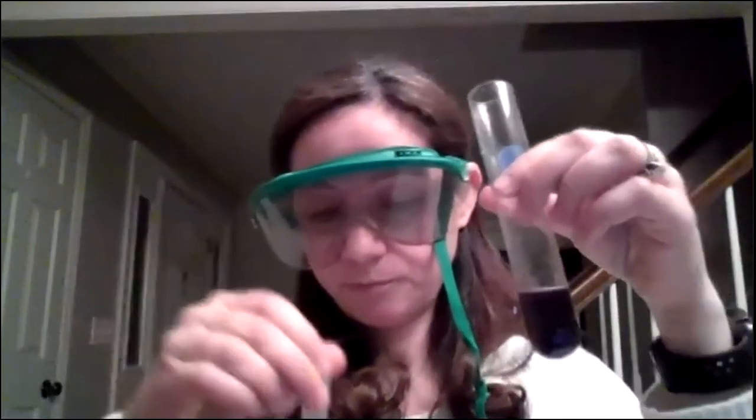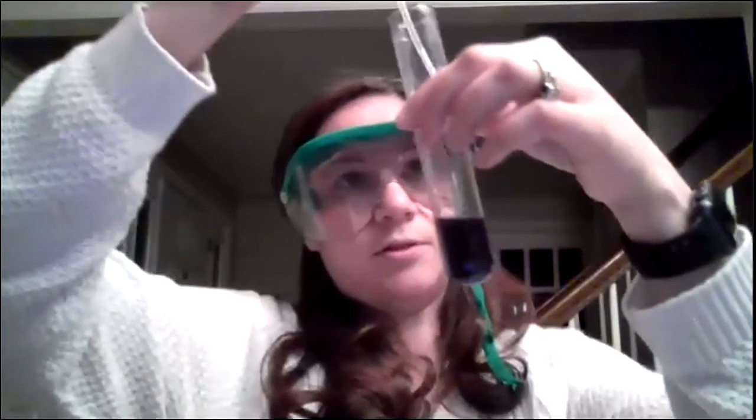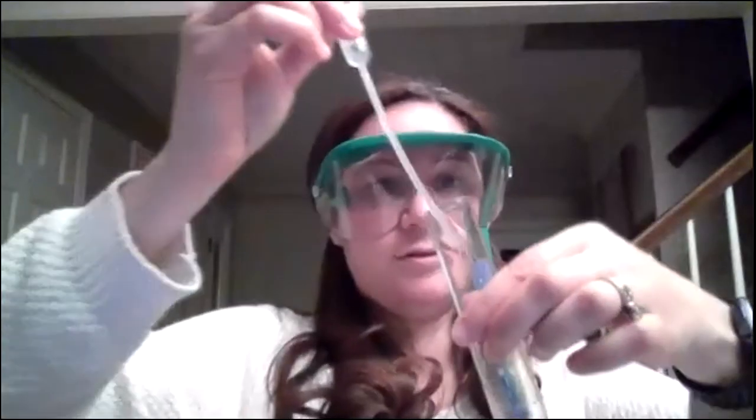So I'm going to keep one for reference, and then the other one, since it's already purple, I'm not going to add hydroxide to it. I'm going to add some H pluses to it. You can't see very well. There we go. So I'm going to add some HCl to this one. So if you remember, the HCl with the water turned from green to like a red color. So we'll see if I add a drop of HCl to this, what's going to happen. So drop, nothing, another drop. I'm going to go ahead and add the whole squirt, nothing. Second squirt, still purplish.